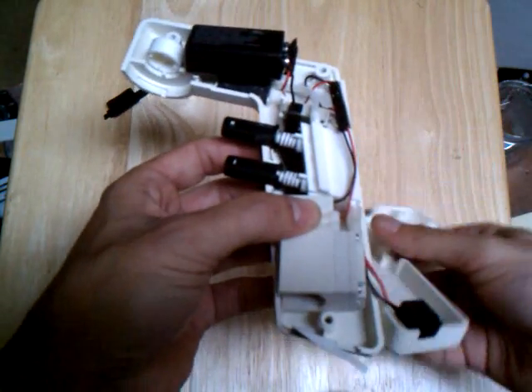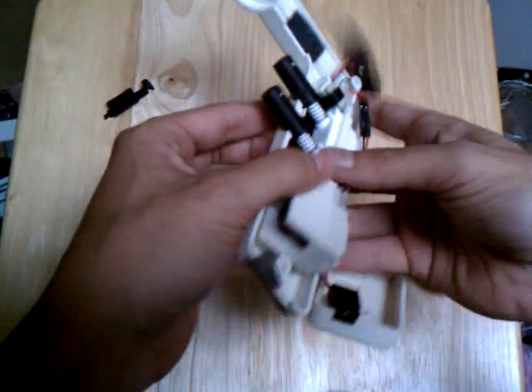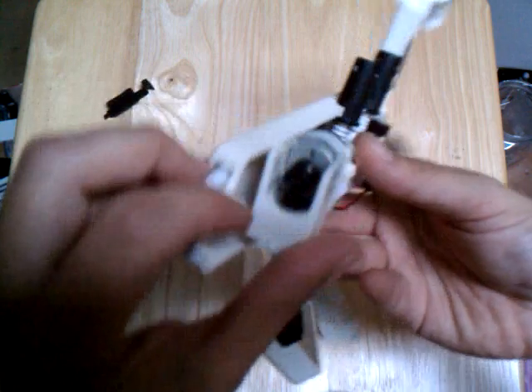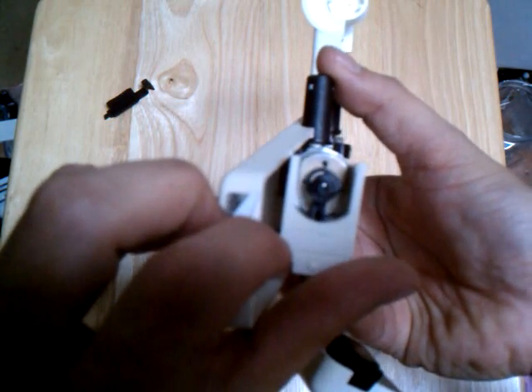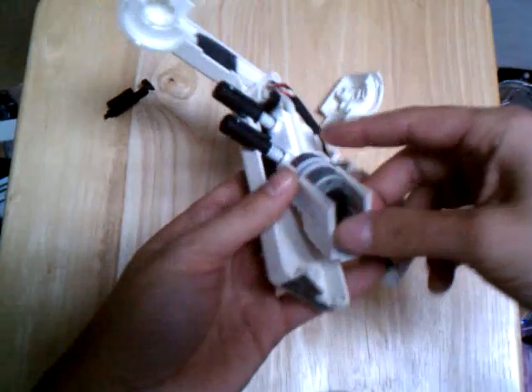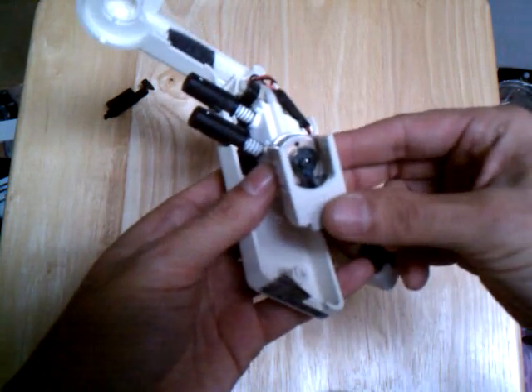The one thing I thought was great in this device was the motor itself. It drives a diaphragm pump — it's kind of a cam-driven mechanism, with an eccentric motion that pushes the shaft up and down, giving a vacuum or suction depending on the selection, giving you dispensing. I saw that and thought, that is really great.